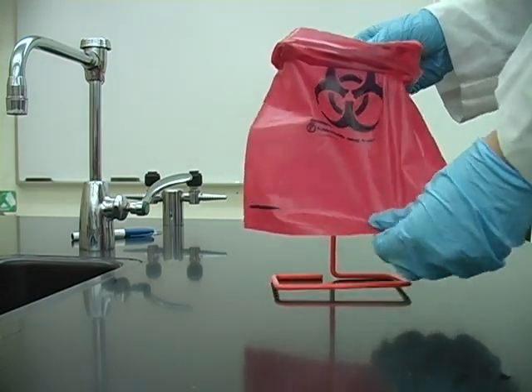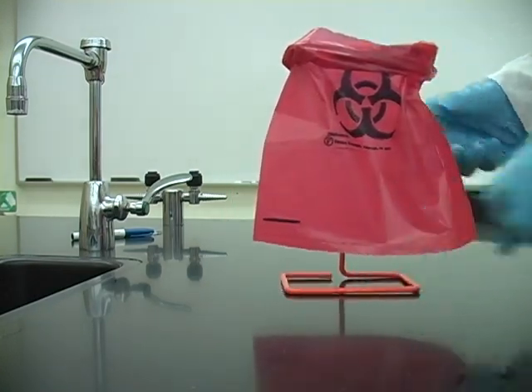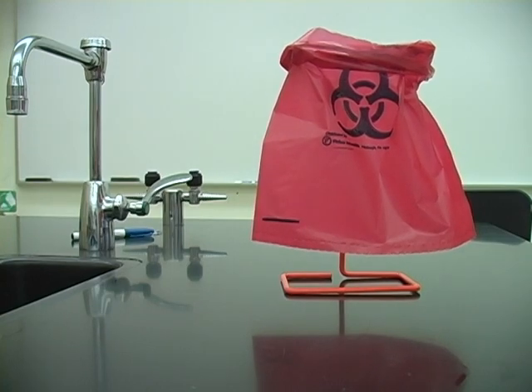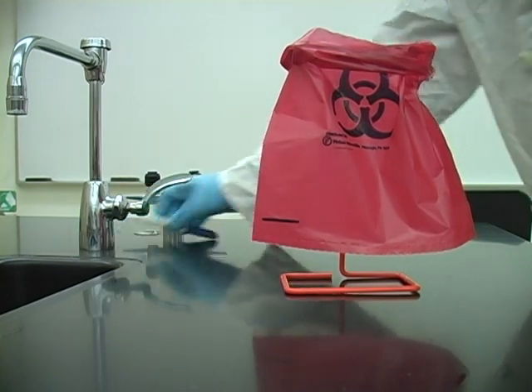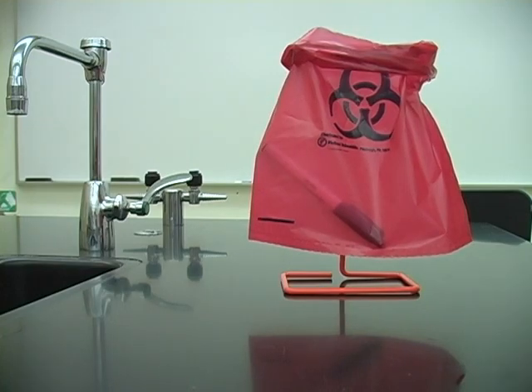Also be sure to set it up before you do anything so that it will be ready for you when you need it. Then when you're finished, put your plate into the bag, tie it up, and put the bag into the appropriate container.